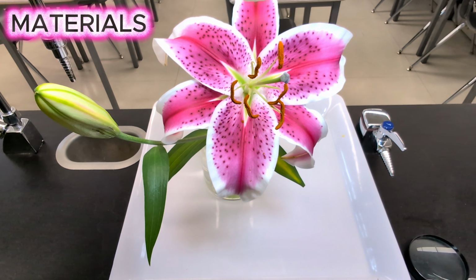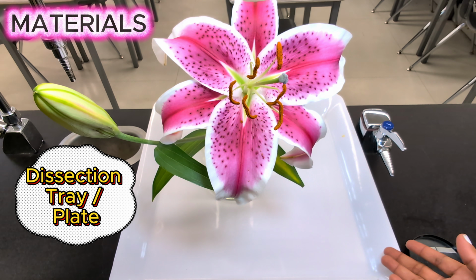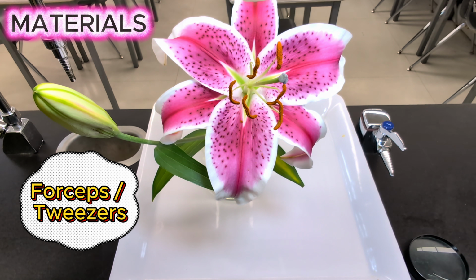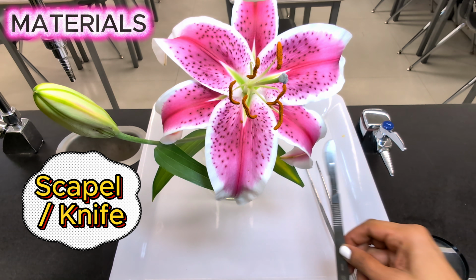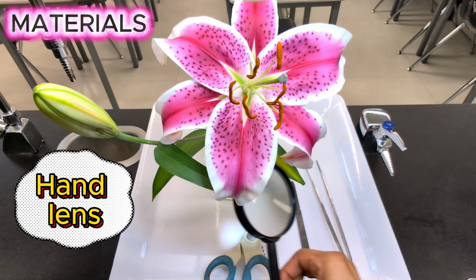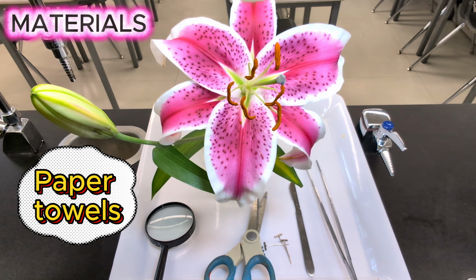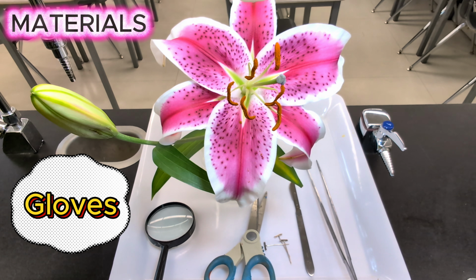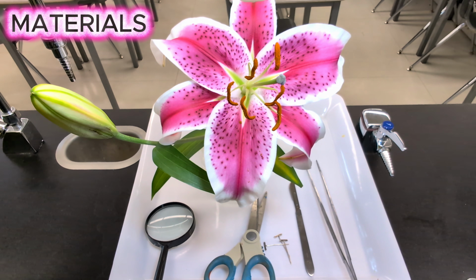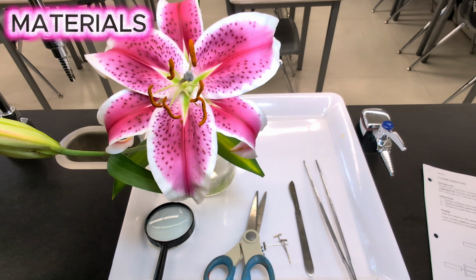Some materials that you'll need for the flower dissection will be obviously your fresh lily flower, a dissection tray or plate, some forceps or tweezers. I just have a big one here. A scalpel or small knife, scissors, a hand lens, maybe some toothpicks, or I have some dissecting pins here, and some paper towels and maybe gloves. The gloves are optional but helpful because the lily pollen can stain. Your lab handout or piece of paper.